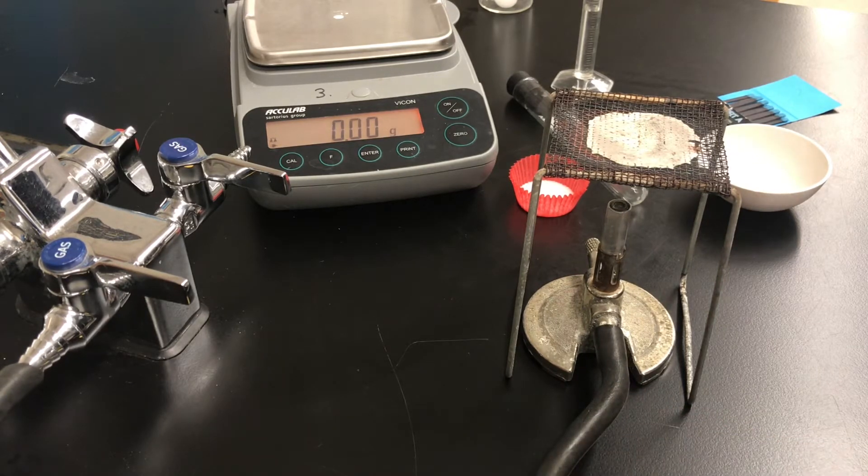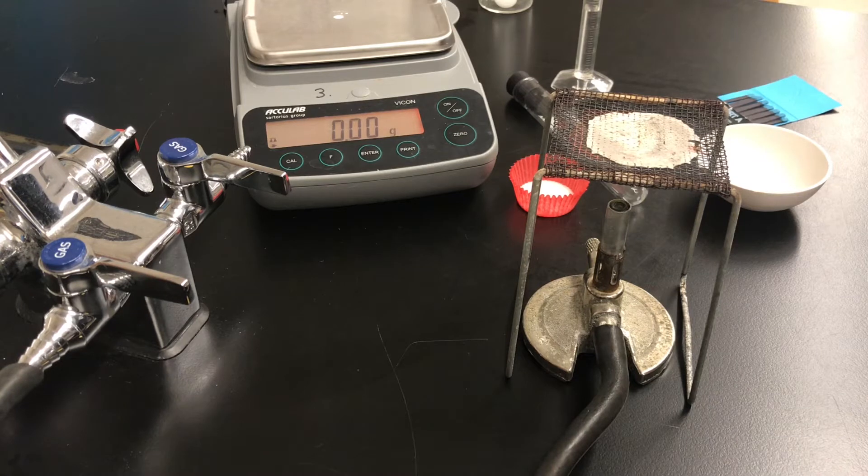The purpose of the experiment is to determine the concentration of a saturated solution or the solubility of a salt. Those two things mean the same thing.